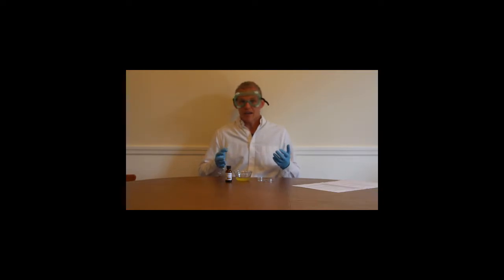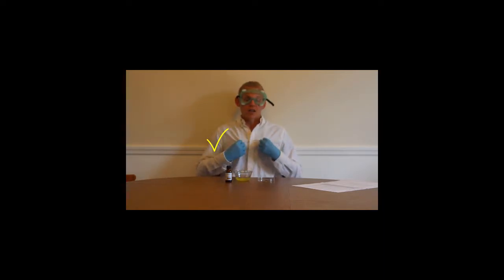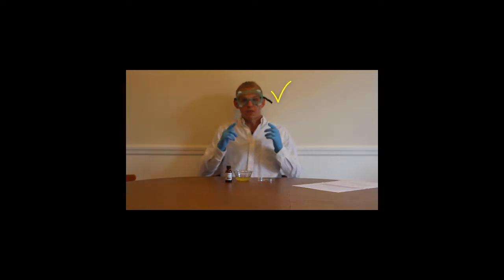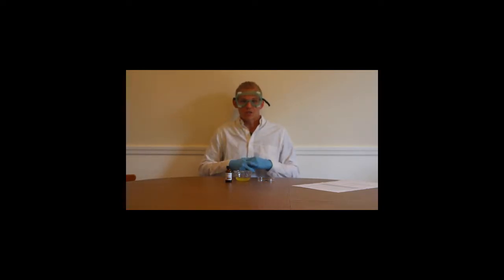you're in any kind of a lab scenario, and you want to keep these things on the entire time, even through disposal. So you see that I have my disposable gloves. These are to protect my hands, and again, they stay on the entire time. This is my long cotton shirt. This substitutes for a lab coat. And then you can see that I have my goggles on nice and tight, and I'm going to keep these on my face to protect my eyes throughout the entire demonstration.